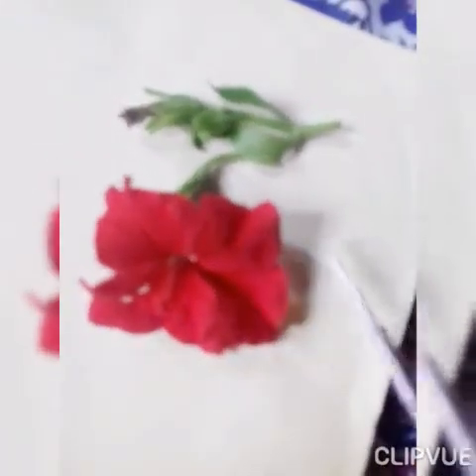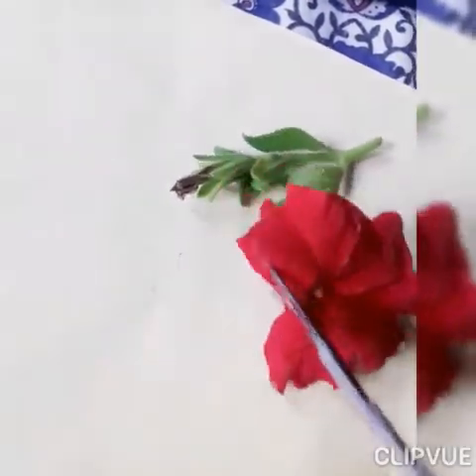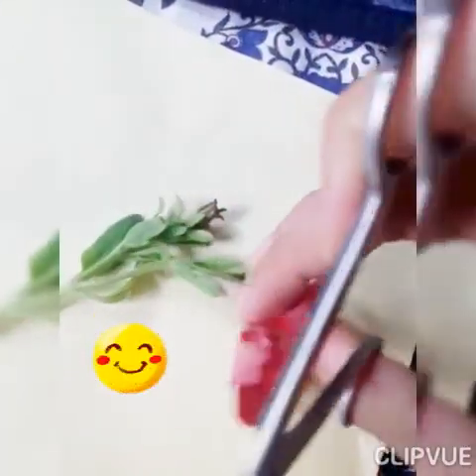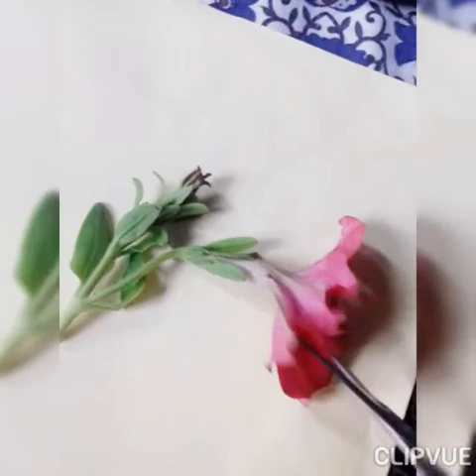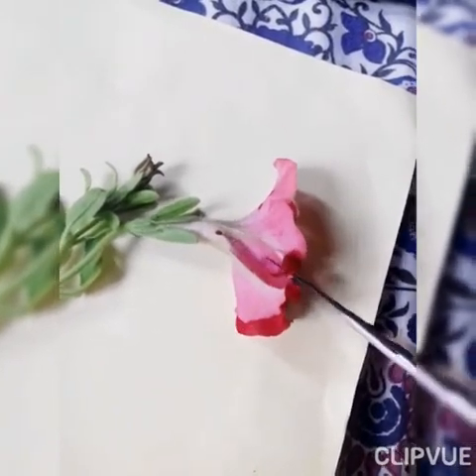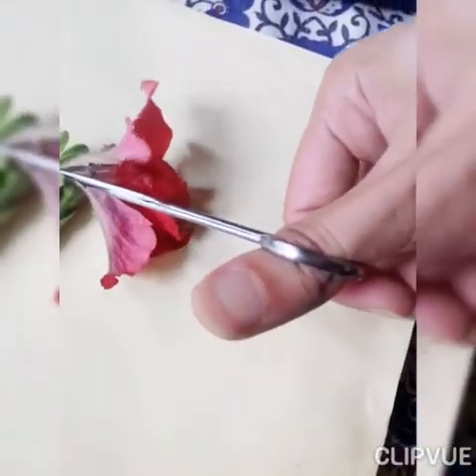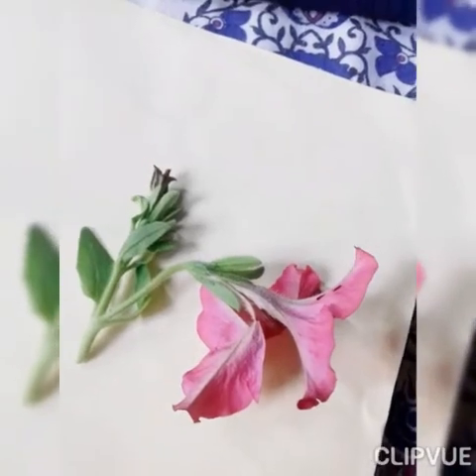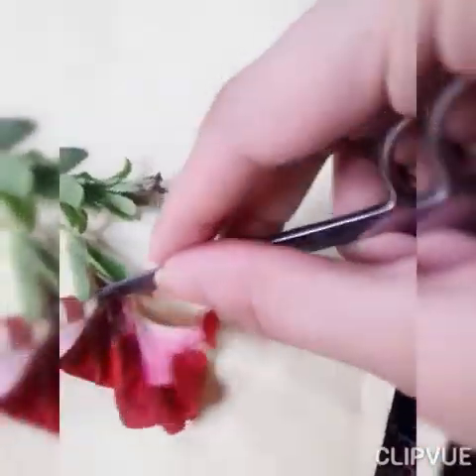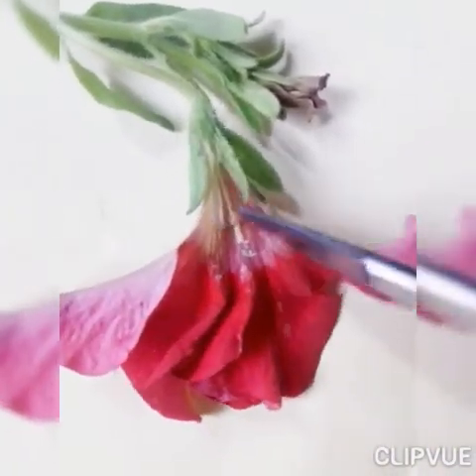This flower I have to cut in order to make a video and show you the inside of the petunia flower, so it is for educational purposes. I'm using the scissor with one hand because in the other hand I am holding the camera to record the video. Now I have cut the flower longitudinally and I'm going to show you the inside of the flower.